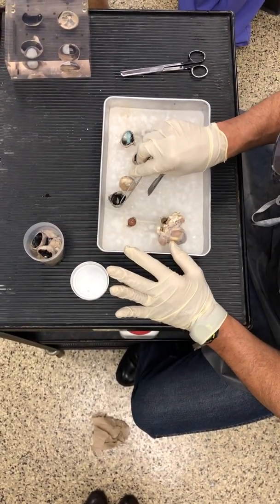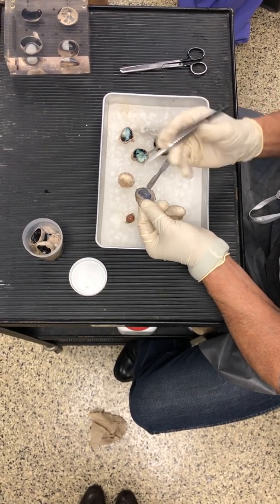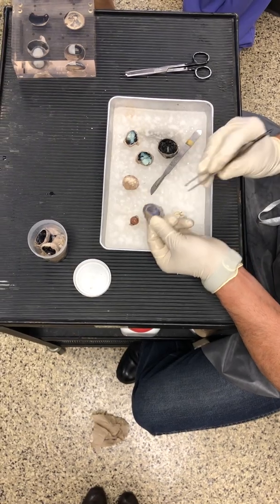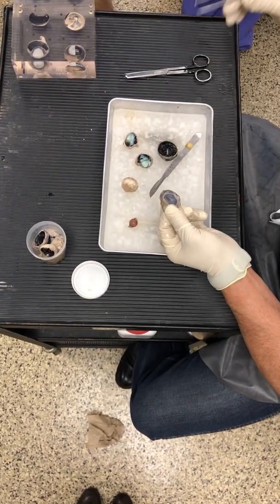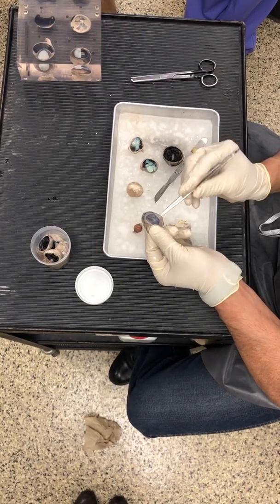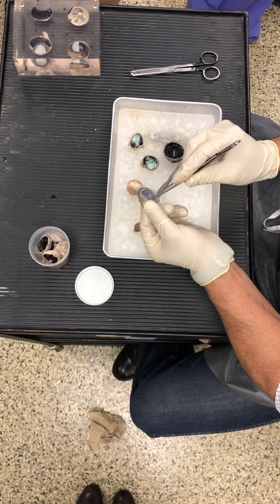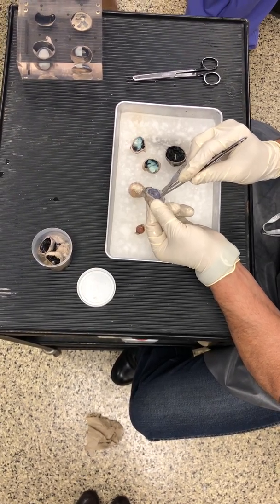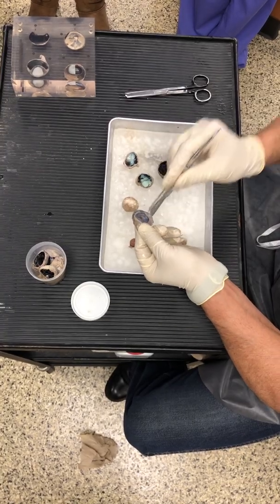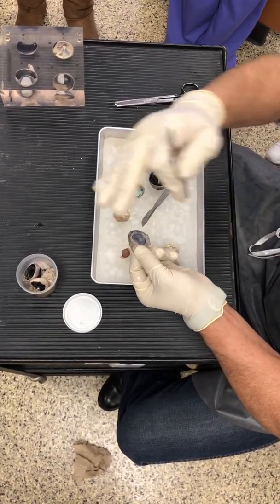Now, one of the things we're going to talk about in lecture is the iris, which is the colored part of the eye anteriorly. I look at everybody's eyes, I see shades of brown, I see shades of green, blue. What that is, is melanin reflecting through here. If you've got brown, green or hazel eyes, lots of melanin is reflecting, and it's reflecting to me as shades of brown.